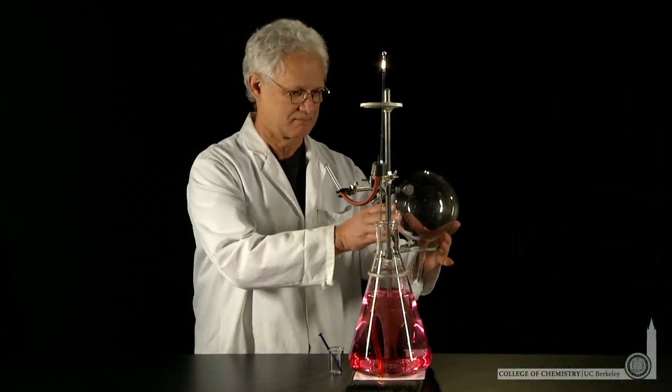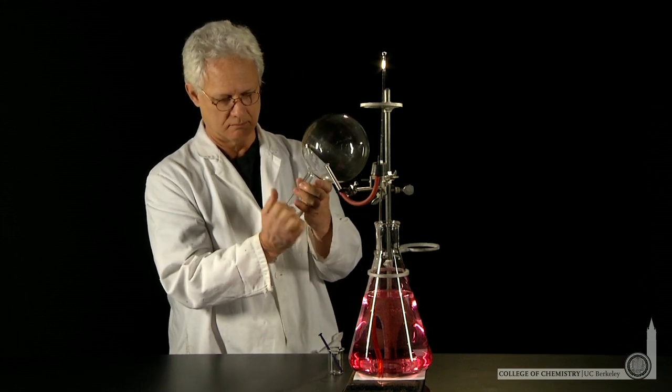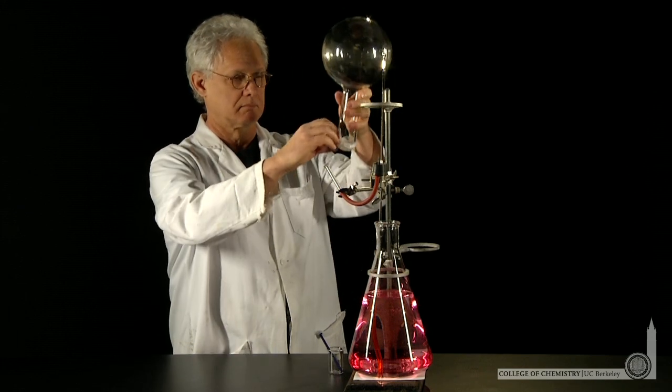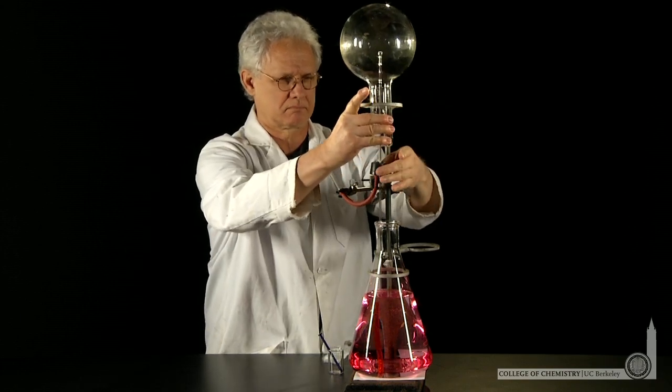We're in the demo lab where Lonnie's prepared to demonstrate the solubility of ammonia gas in water. This flask that he's opening is full of ammonia gas, and he'll put it on the apparatus and seal it.